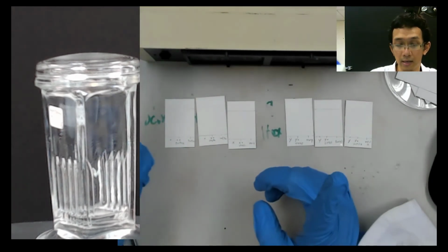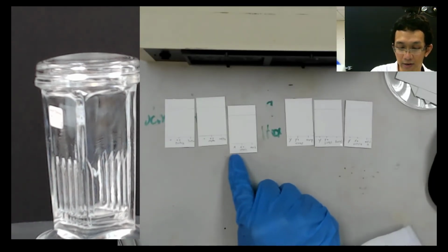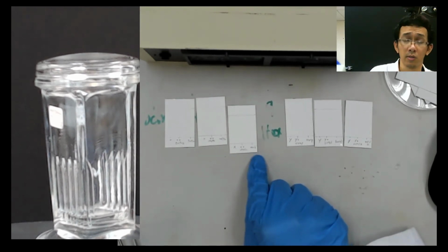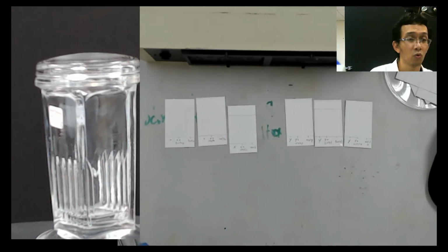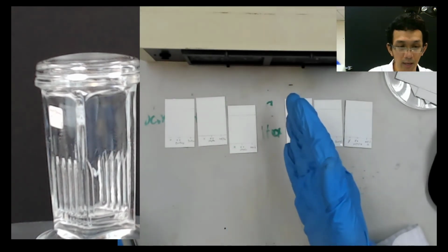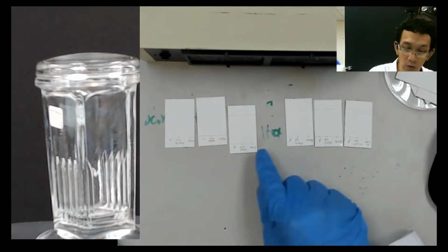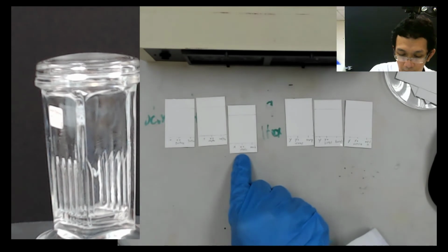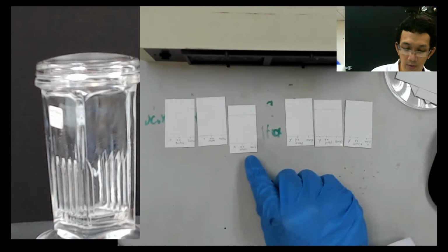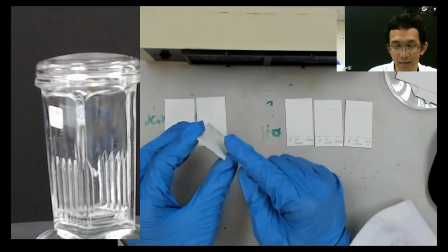Secondly, on top of this there are 3 different things: compound A plus something, compound B, and so on. If you want to stain, normally you need a specific stain for a specific thing, because stains work by binding with some molecule, the X, the B and C. UV is different, because we are just visualizing the silica only.